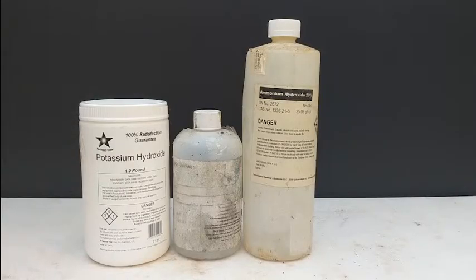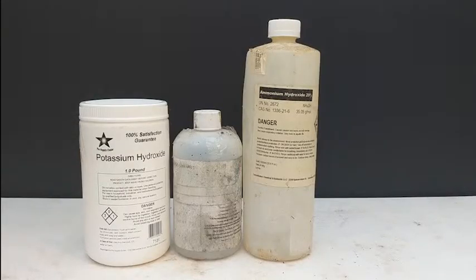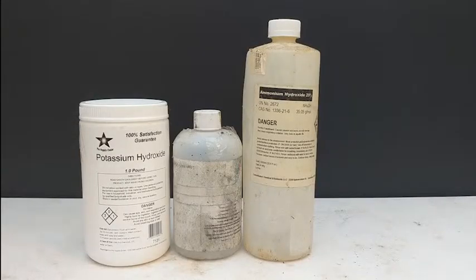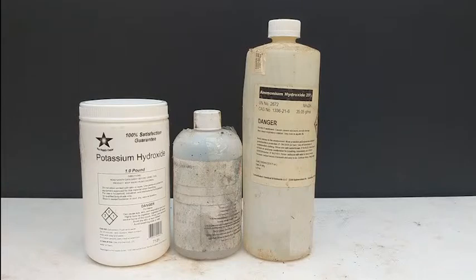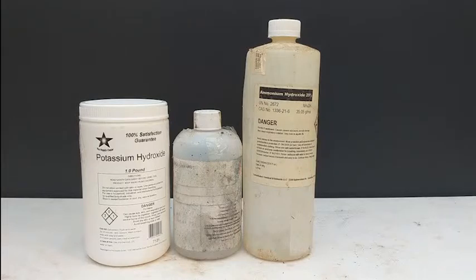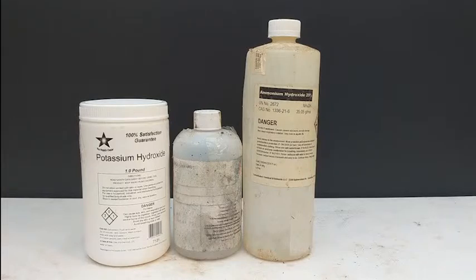Greetings fellow chemists. Welcome to Awesome Chem. Today we will be synthesizing ammonium acetate for an upcoming project.